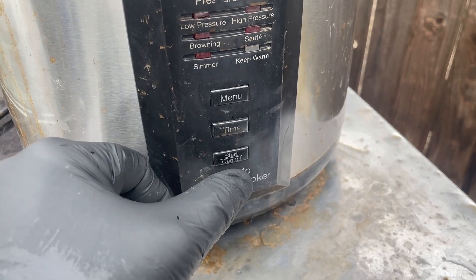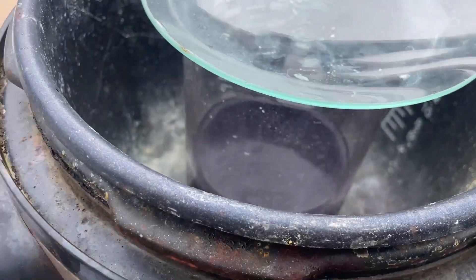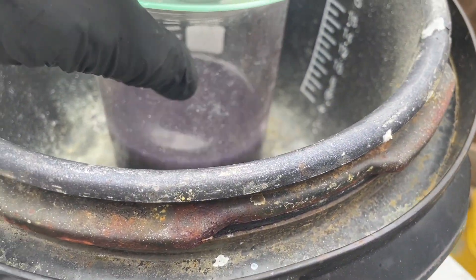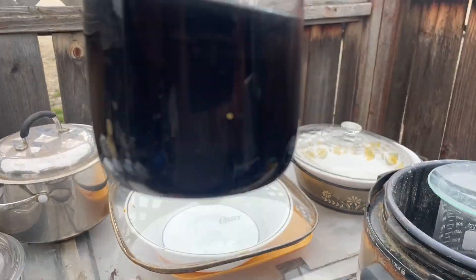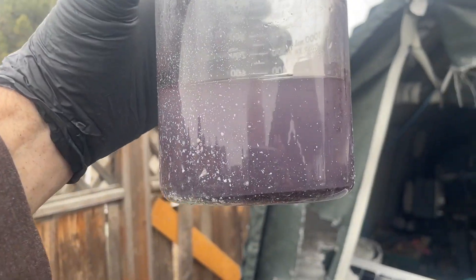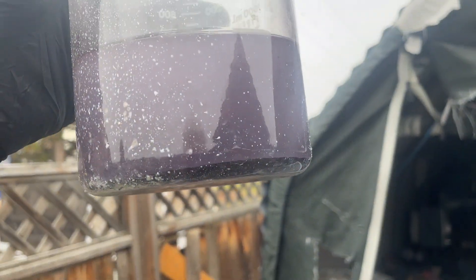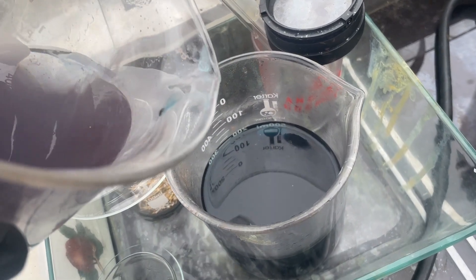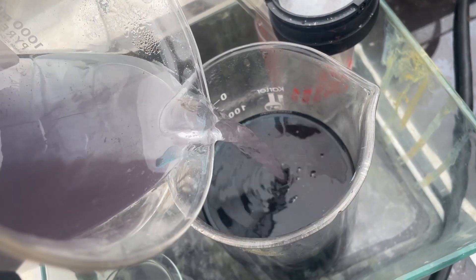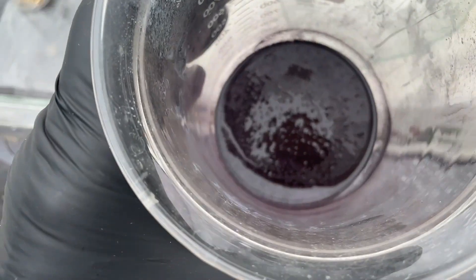Let's get it to simmer — simmer down. Let this go for a little bit and let it settle kind of under heat. The material is starting to settle out — you can see a little bit of material there in the bottom. I'm going to put that material into aqua regia shortly. I think we've got it down to the wire here.